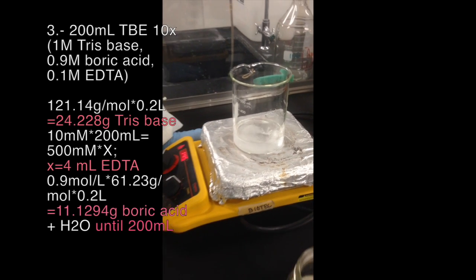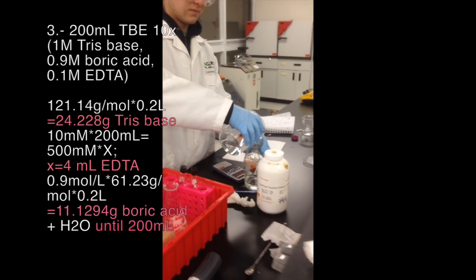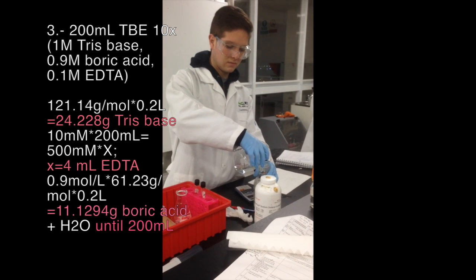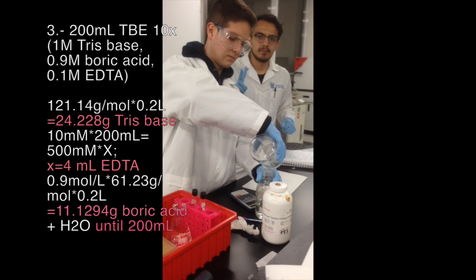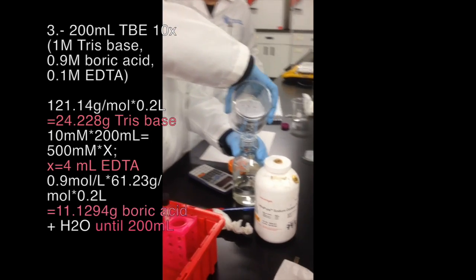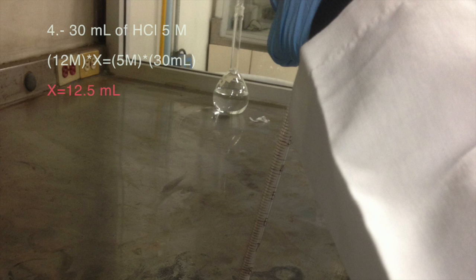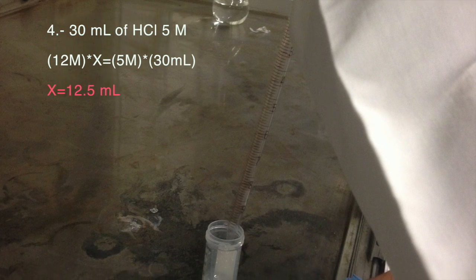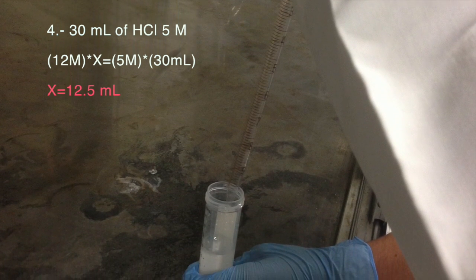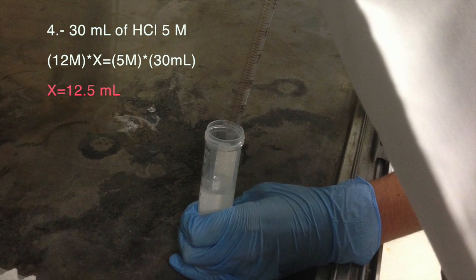For the third experiment, we added 24.22 grams of Tris base to 100 milliliters of water and we put that onto a hot plate and agitated it with a magnetic bar for 5 minutes, and after that we added 4 milliliters of EDTA, again with a hot plate and agitating. Finally, we added 11.12 grams of boric acid. When it was dissolved, we added water until a volume of 200 milliliters. The last solution was done in an extraction booth. We added 12.5 milliliters of hydrochloric acid into 17.5 milliliters of water. All of the solutions made were labeled.